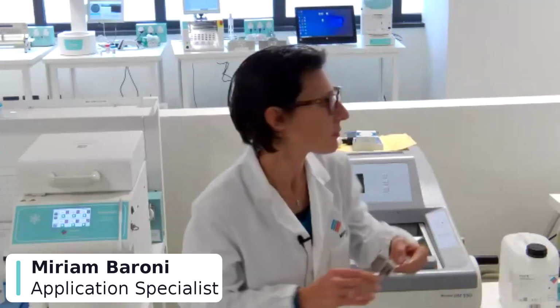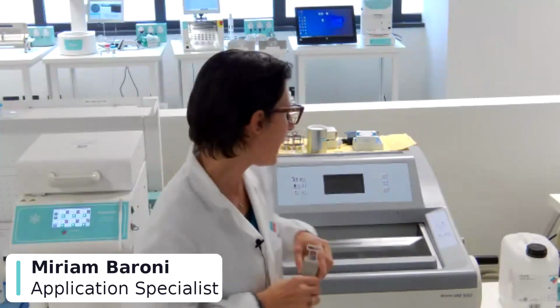Thank you, Miriam. One final question about the Presto Pro. How many slides can you process in Presto Pro, and how much time do you need? Okay. In Presto Pro, we can insert this rack in which we can put up to 6 different slides. Moreover, we have an arm with a double position, so we can work with 2 racks, so 12 slides simultaneously. About the time, there are 2 standard protocols in Presto Pro. One lasts 4 minutes. The other one lasts 2 minutes and 20 seconds.